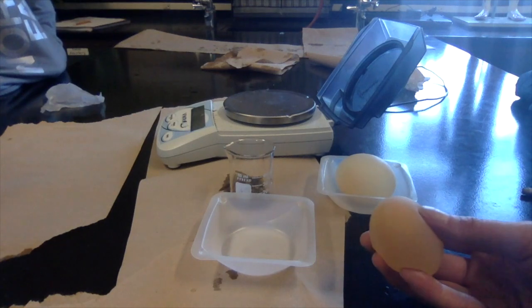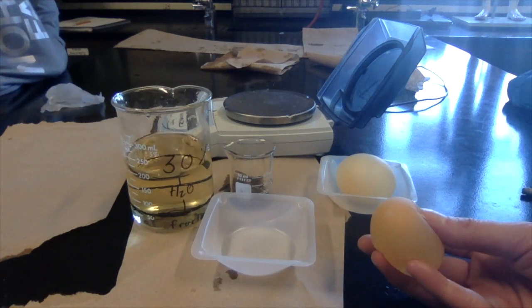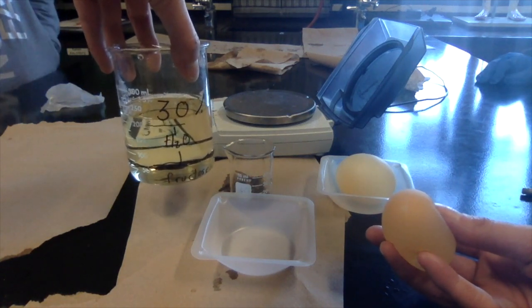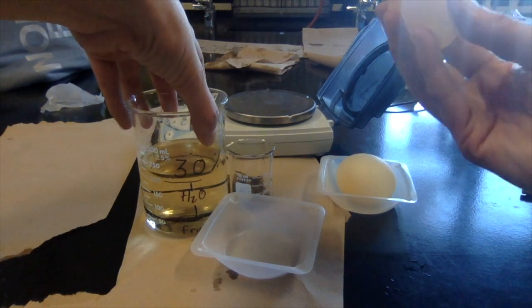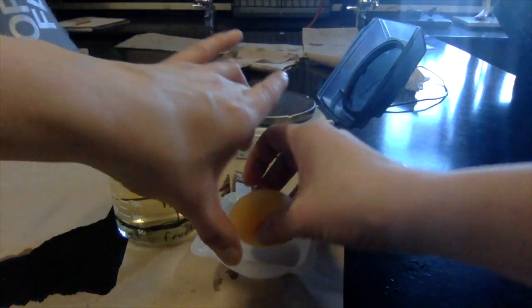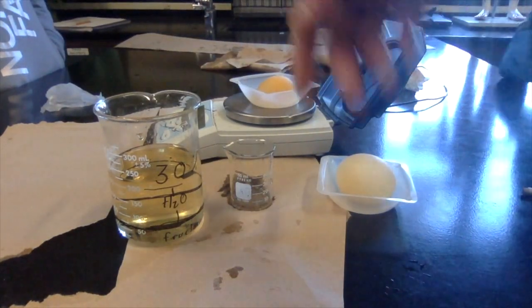But wait a minute. We have more fluid in here. Is it thicker or still liquidy? Still liquidy. Maybe even more liquidy. So if it's more liquidy, what went in there? Water. So what left the egg? Fructose. If we got more water, so water left the egg, went into here. So what method of transport happened if it was water? Osmosis. Okay, so record your results.